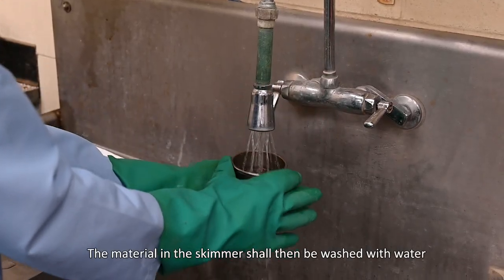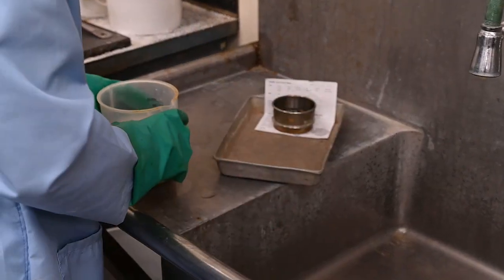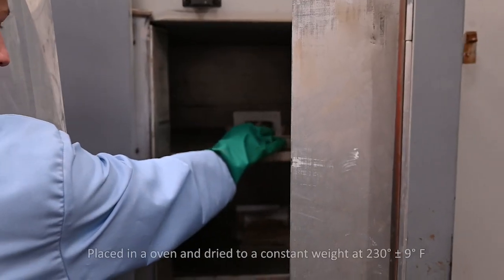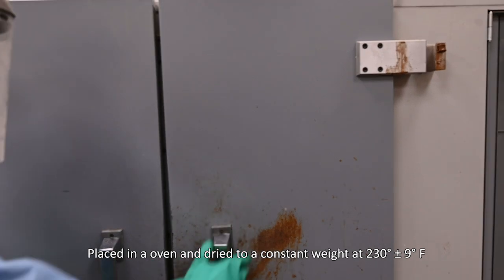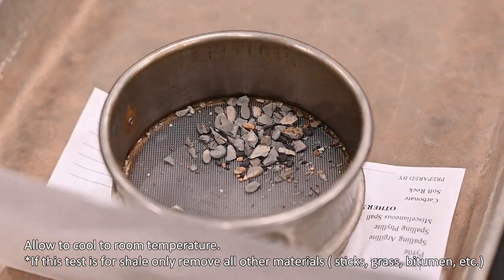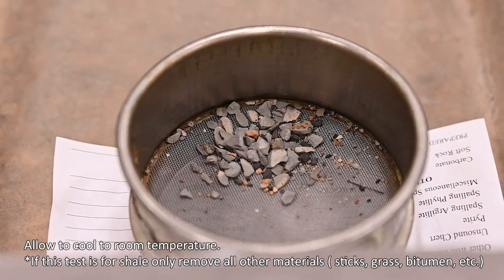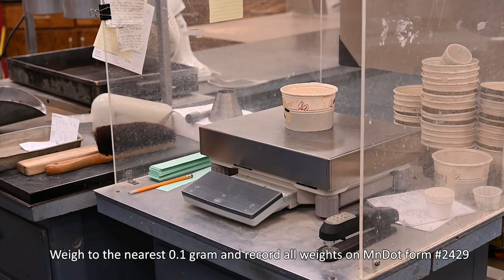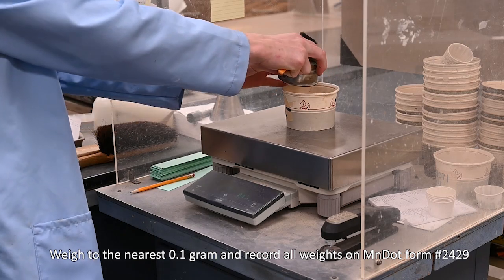The material in the skimmer shall then be washed with water. Placed in an oven and dried to a constant weight at 230 degrees plus or minus 9 degrees Fahrenheit. Then, allow to cool to room temperature. If this test is for shale only, remove all other materials, such as sticks, grass, bitumen, etc. Weigh to the nearest 0.1 gram and record all weights on MnDOT form number 2429.